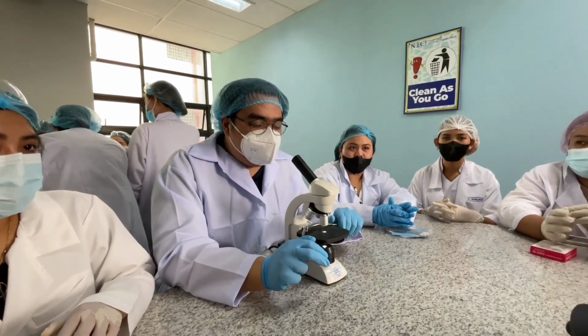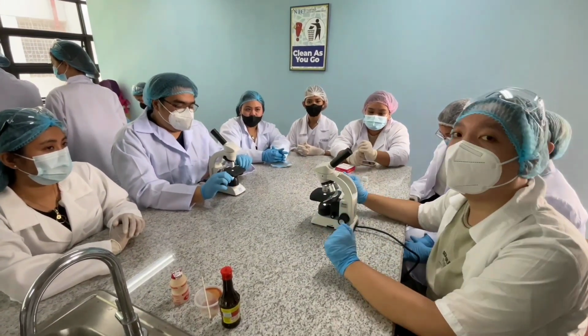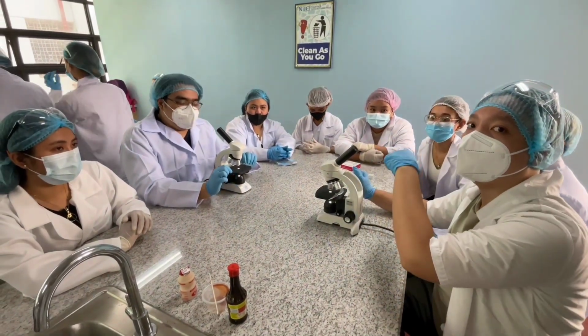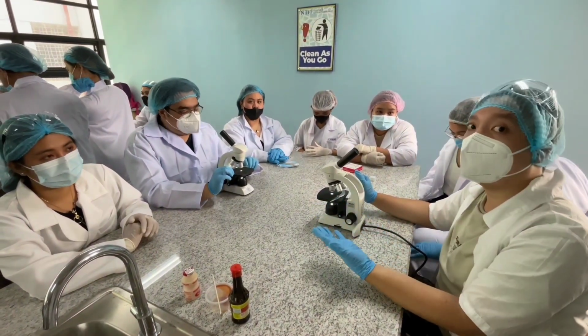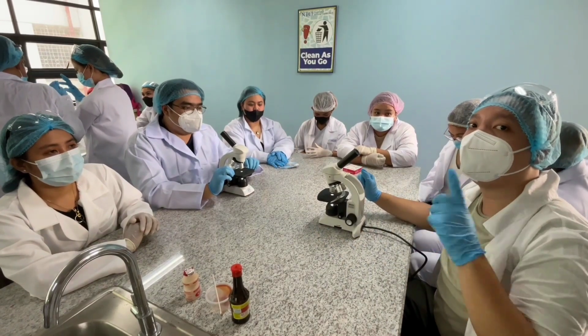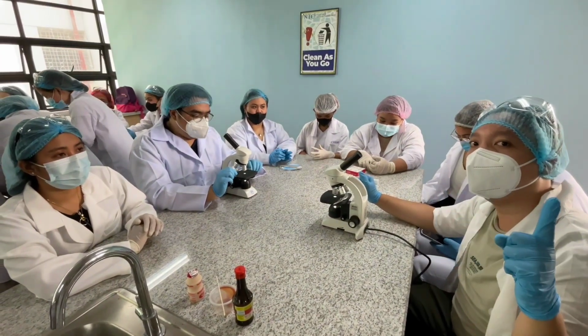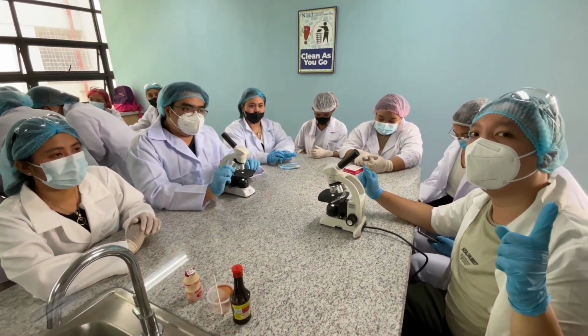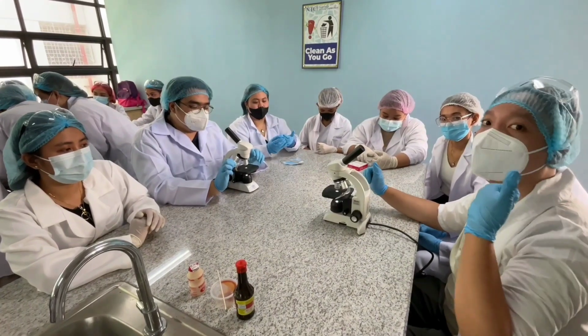So that's what we call the electric microscope. So this afternoon, we're going to begin and demonstrate to you what the functions are and also how to actually use them in conducting our experiment inside the chemistry laboratory. And of course, again guys, just like our first video in the introduction, make sure to wear your PPE for our safety as well. So let's begin.